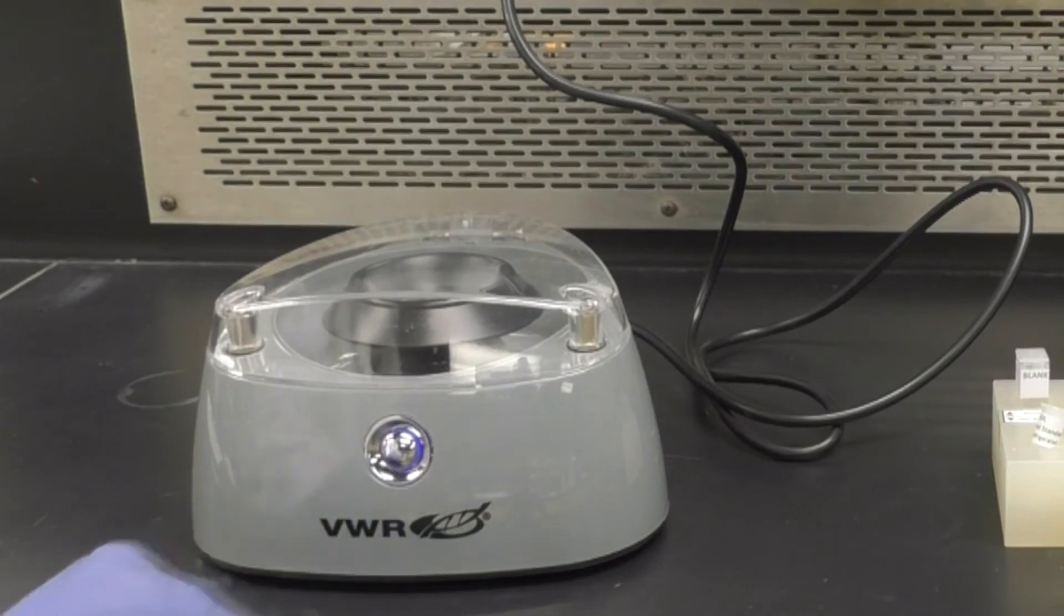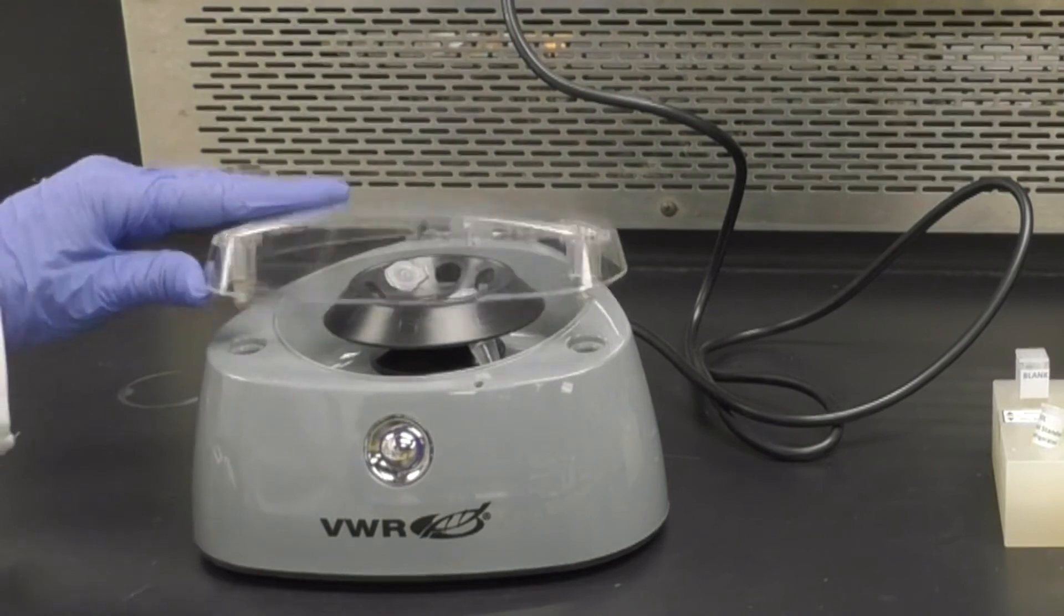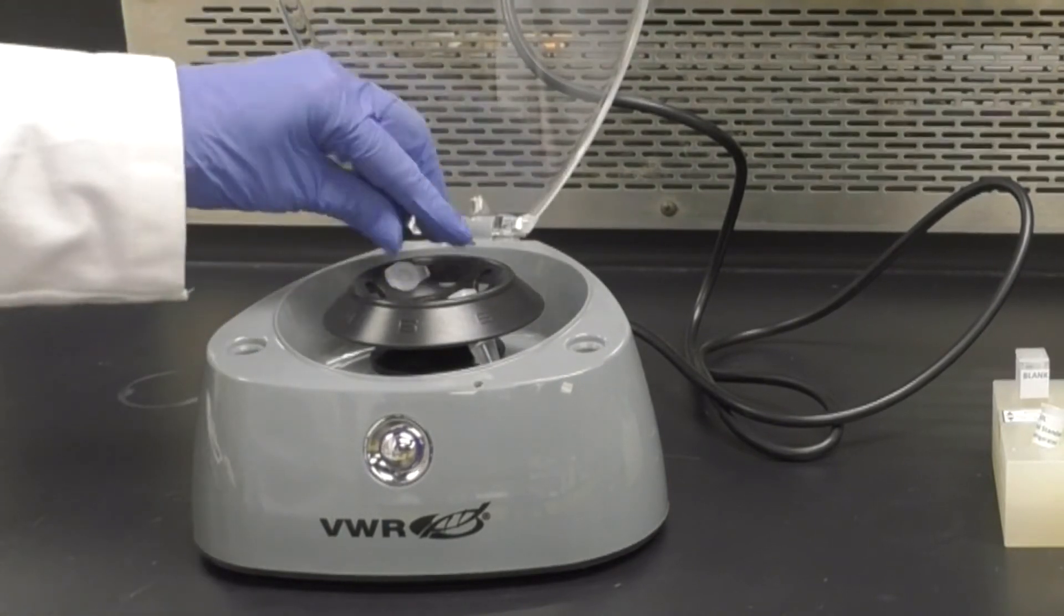After 10 minutes, stop the centrifuge by pushing the silver button on the front. The rotor will stop and the lid will open automatically.